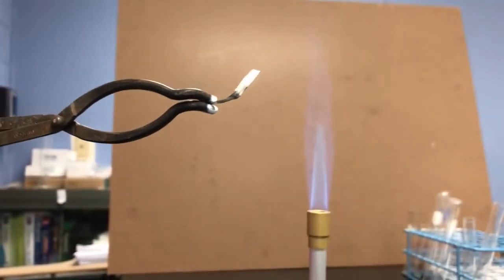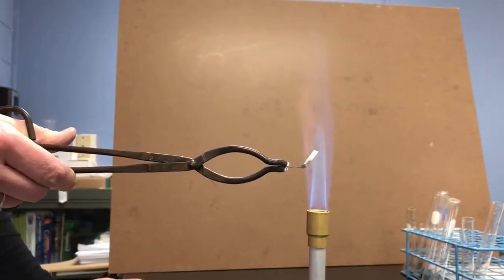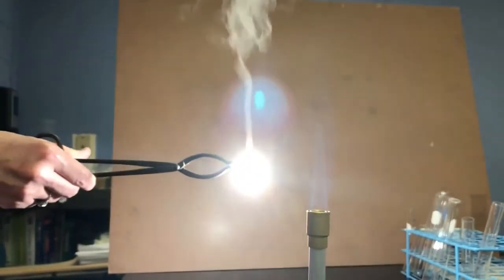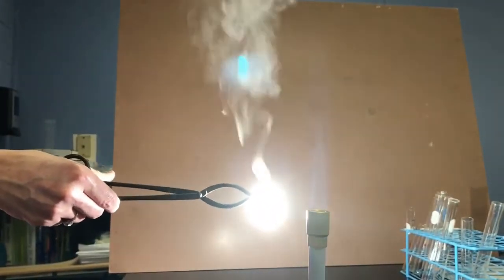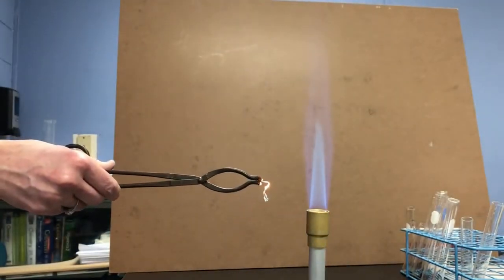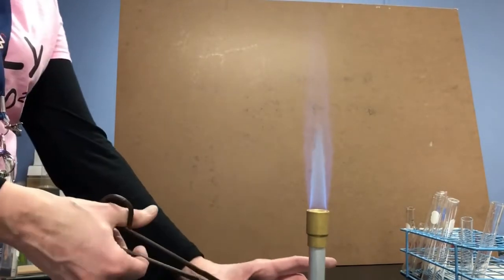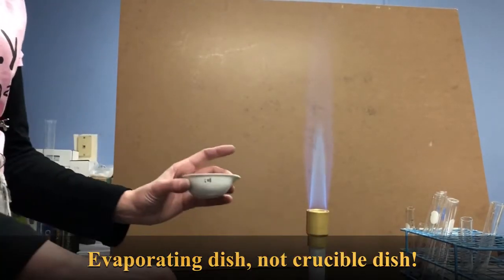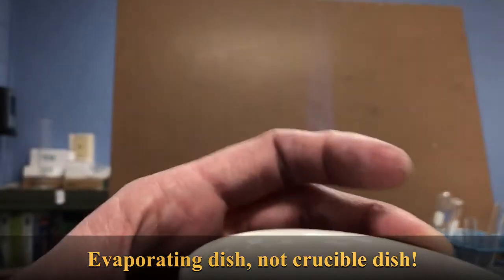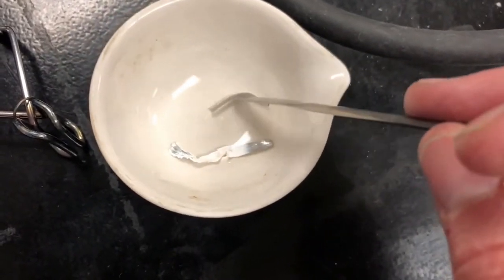Now, on a video recording, you're not going to have to worry about the brightness, but if you were looking at this in person, you would not want to look straight at the bright light, because it does release UV light, which isn't good for your eyes. And now that that has burned, I'm going to drop it into a crucible dish so we can examine the properties using a spatula.